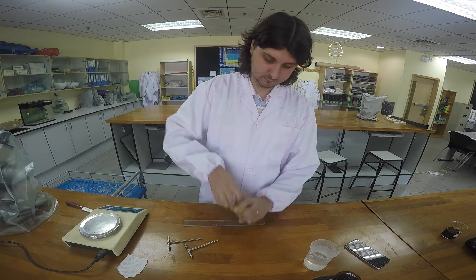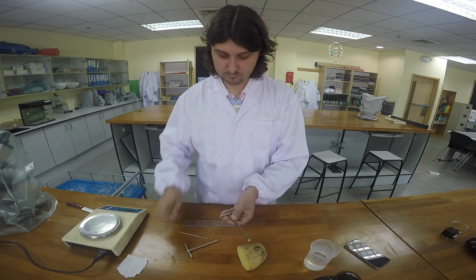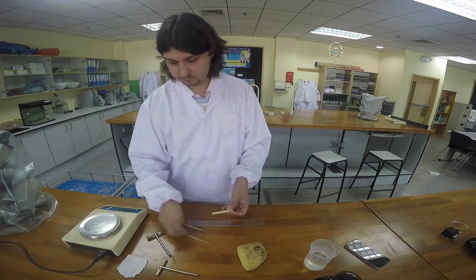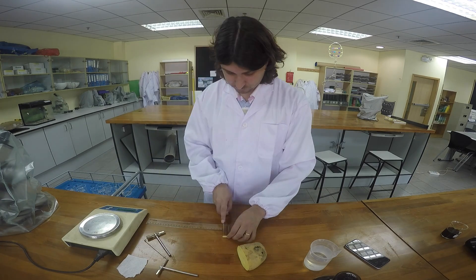Using a cork borer of known diameter, extract a potato cylinder from a large potato. Then cut the cylinder to a known length using a ruler and a knife.